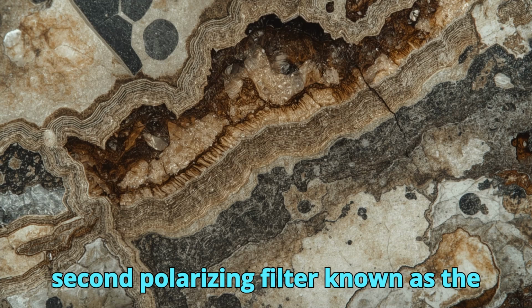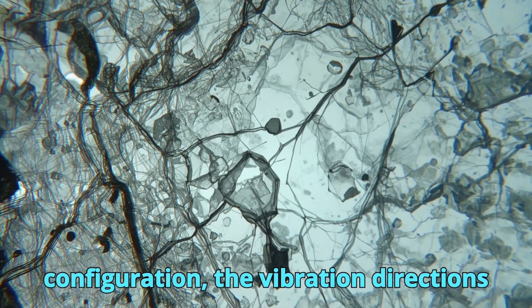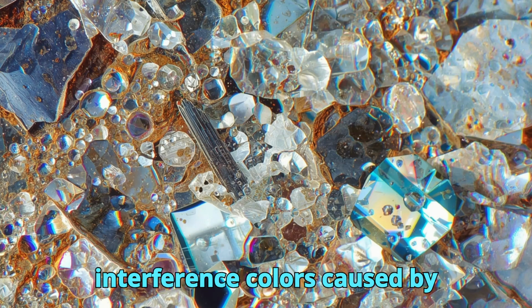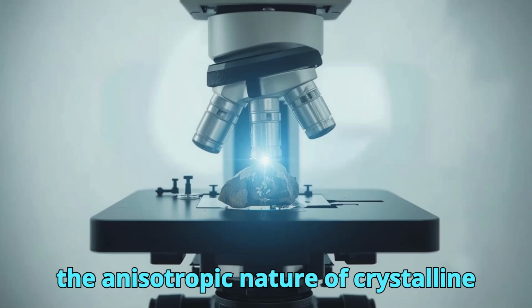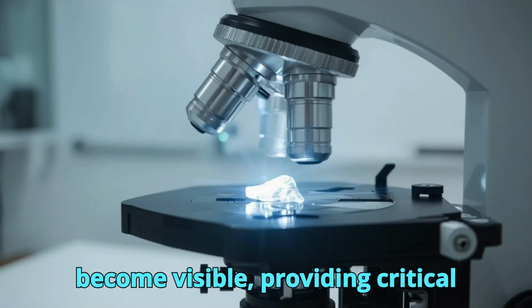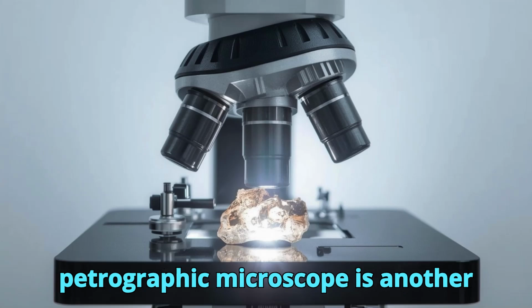Above the objective lens, a second polarizing filter, known as the analyzer, can be introduced to create cross-polarized light, XPL. In this configuration, the vibration directions of the polarizer and analyzer are perpendicular to each other. Most minerals then display characteristic interference colors caused by birefringence, a property resulting from the anisotropic nature of crystalline structures. Under cross-polarized light, features such as extinction behavior, twinning, and interference color patterns become visible, providing critical diagnostic criteria for mineral identification.